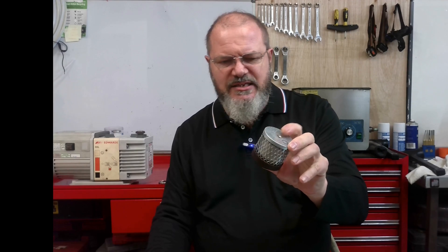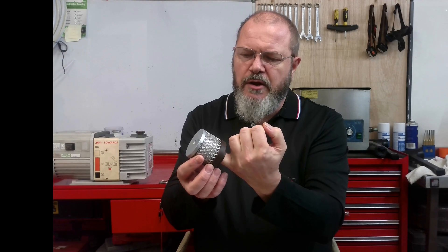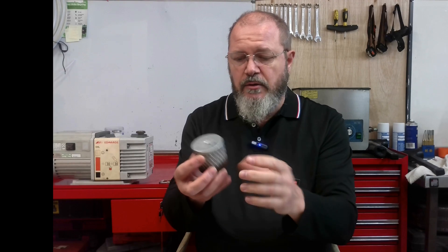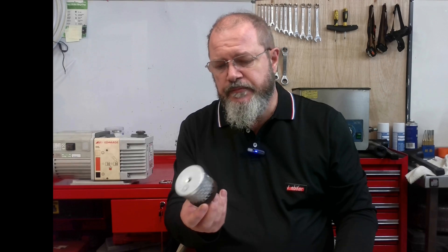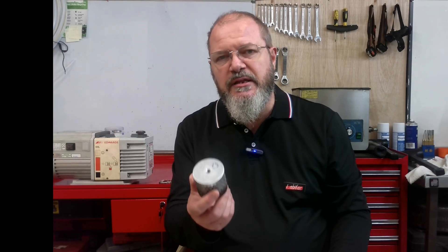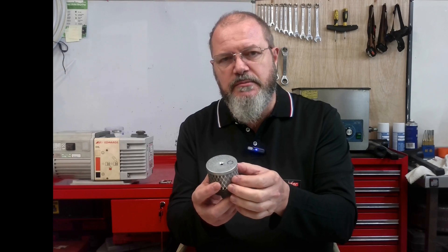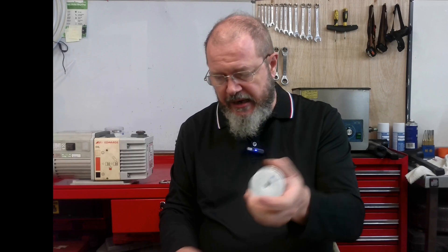This is a coalescing filter. The exhaust of the pump will flow up through the inside of this, and then flow through the filter and out. The filter is rated at 0.3 microns, so this will give us 99.97% efficiency in trapping the oil. The oil particles are too large to fit through the filter membrane, whereas the air is able to pass through.